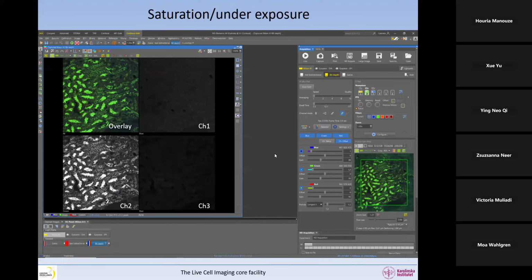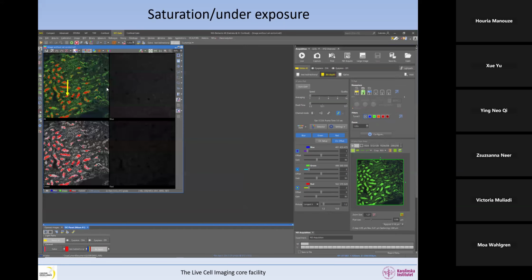So here is an image where we have the overlay in color, and then we have 3 channels. At first glance, one could think that there's a problem with these 2 channels because they're very dim, whereas this one is fine because we can see. But that is only if we just believe our eyes and we don't believe the numbers. Really, if we put the saturation mask on, what we can see as the problem is in this channel and not in the other 2, even though they are dim and they should be brighter.